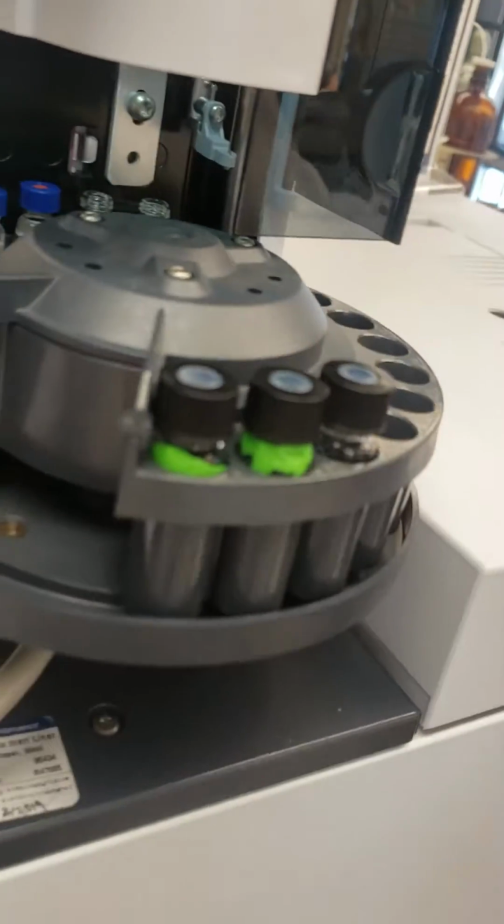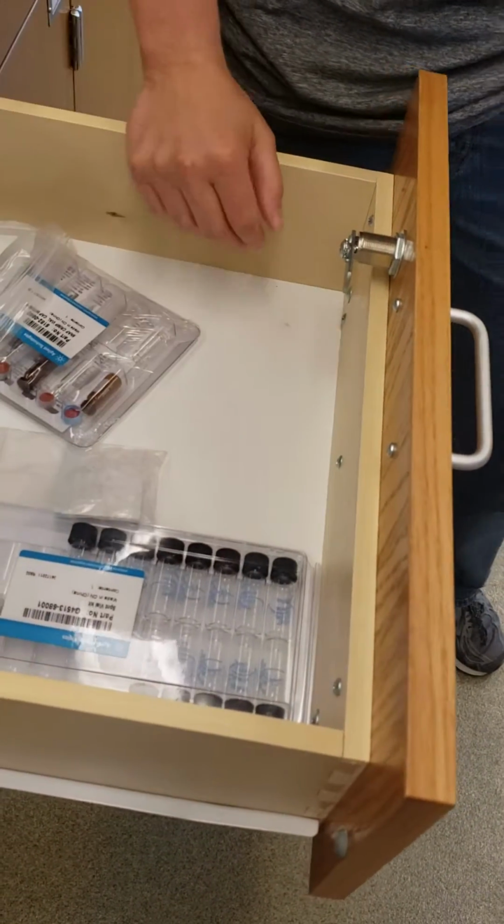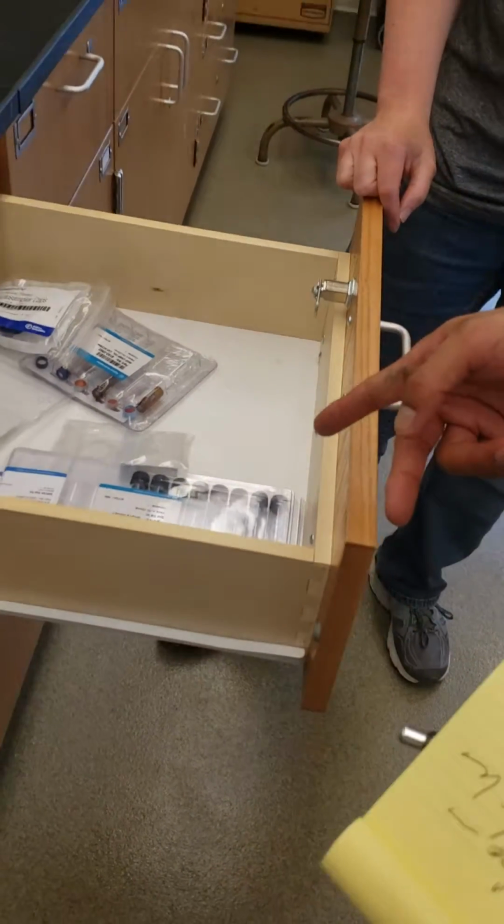They probably tried to wash it twice, because they would have two different washings, a pre and post injection. Yeah, we must have those here. We don't have those. We have just the little ones. That's fine. There are more vials. Sample vials. There's a few wash vials, a few sample vials. Yeah, sample vials we have, but we don't have the washing ones. Can we borrow some? Yes.